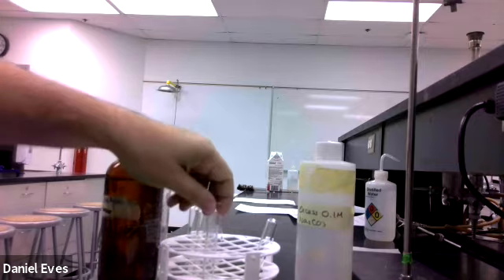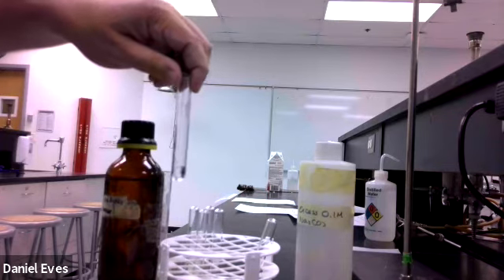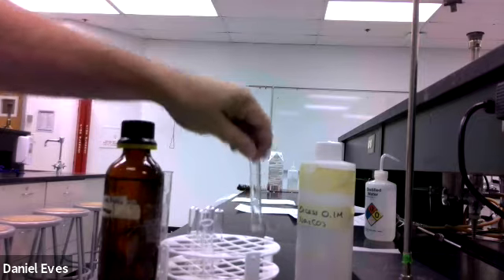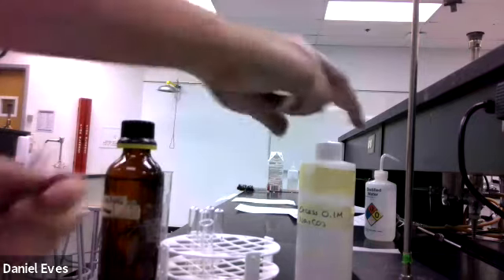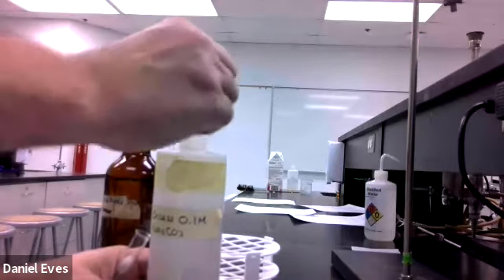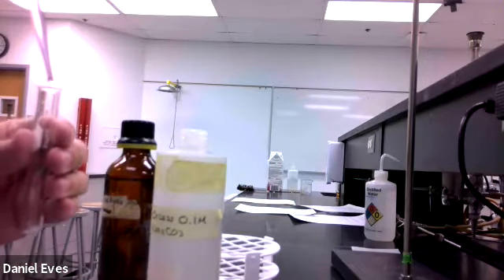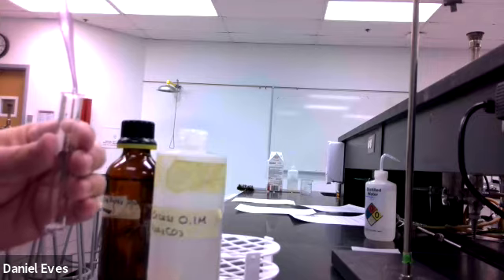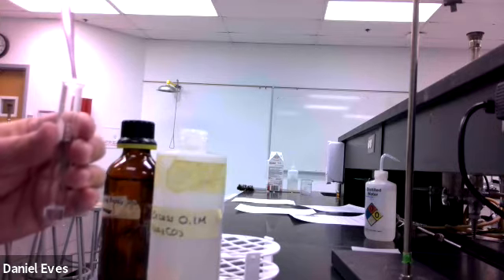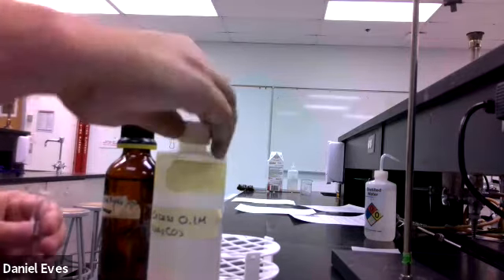What I am going to do now is the first experiment, which is section B. This is 1 milliliter of silver nitrate, and here I want to put 1 milliliter of sodium carbonate so you can see what happens when we mix those together. So to do this, I need to put in 20 drops. 20 drops of the sodium carbonate.